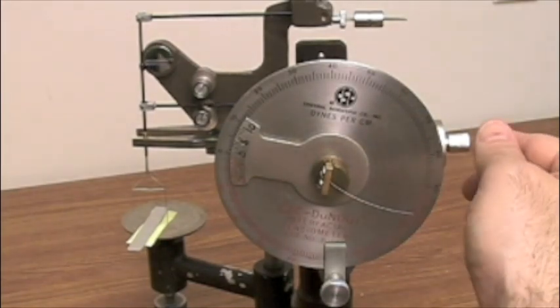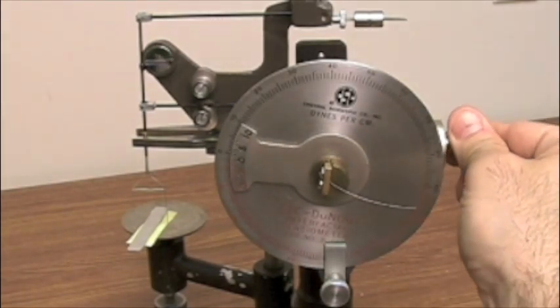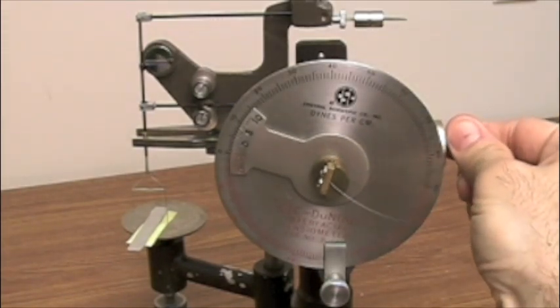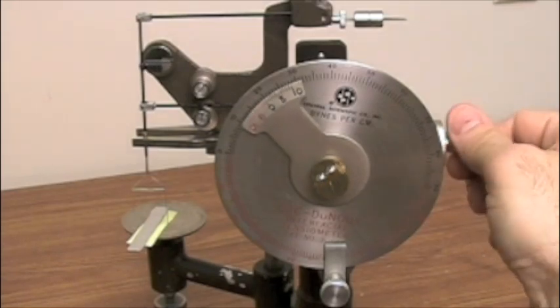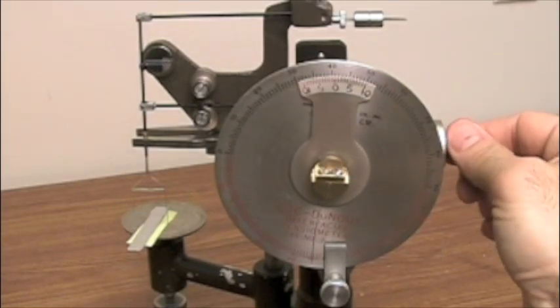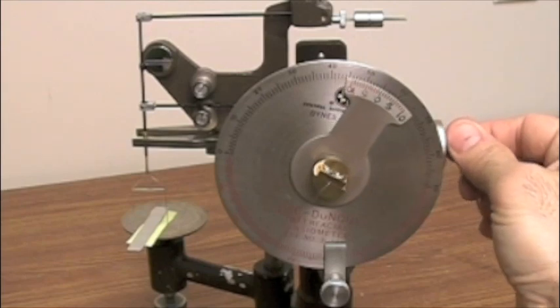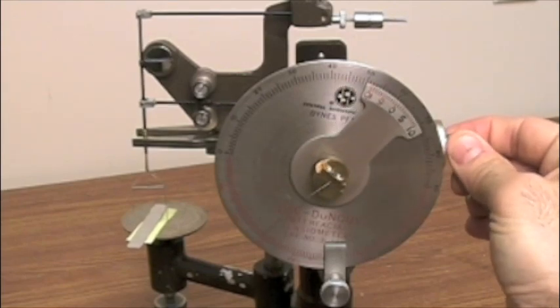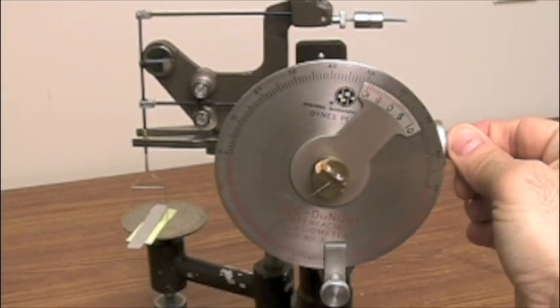What we're going to do is we're going to adjust so that we get the needle to a set position here. In this case, we line it up.